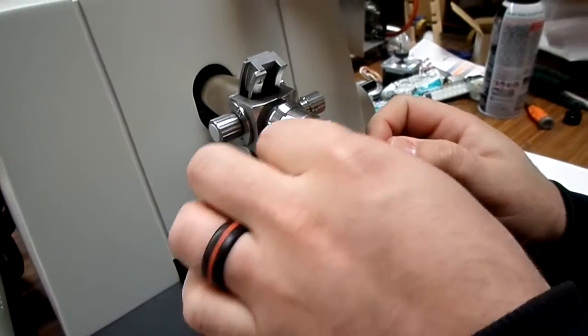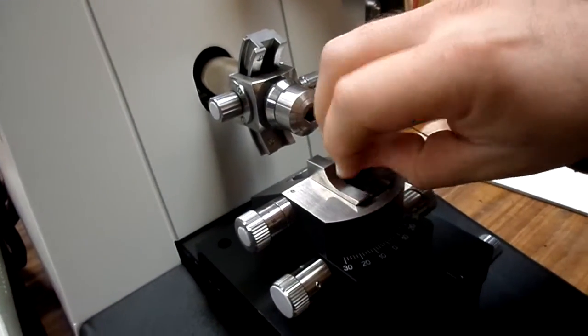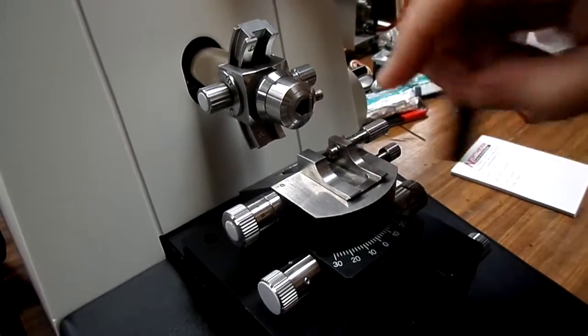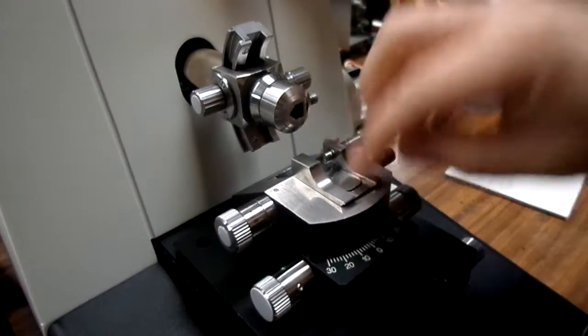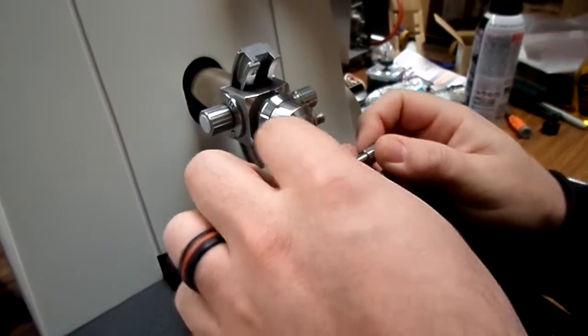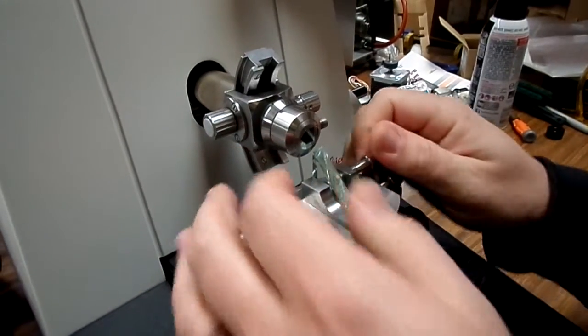If the blade is too tall, you can take out the little insert here, and then you'll have a deeper section to put your blade in. So that's it for the blade holder.